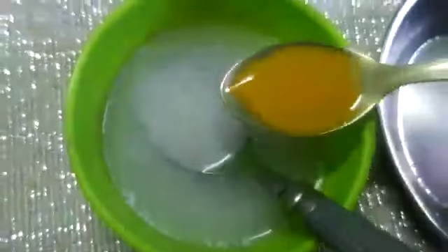Now, to the soap solution. The color changes to red.